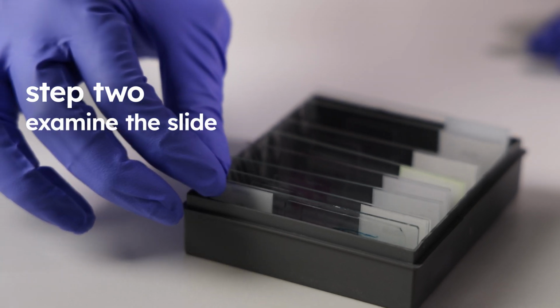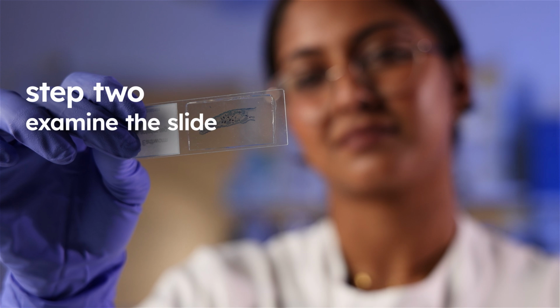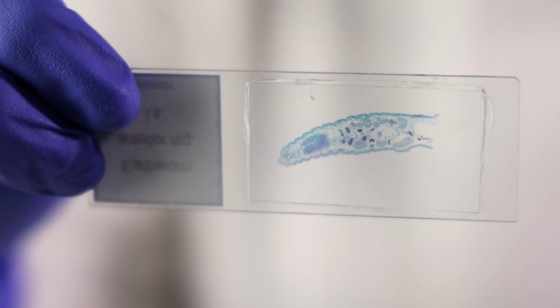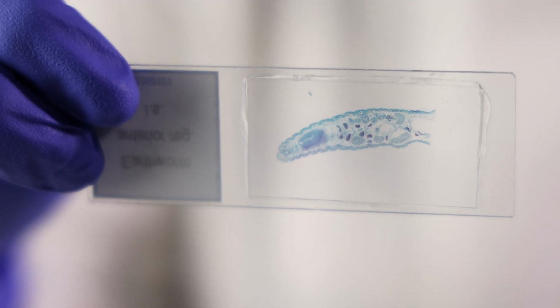Hold the slide up and look at the sample with your naked eye. Take a mental note of its shape. Is it circular? Oblong? Is it symmetrical? Or does it have a distinctive shape on one side? That first clue helps you stay oriented once you've magnified it. In this case, it's oblong, shaped a bit like a banana.